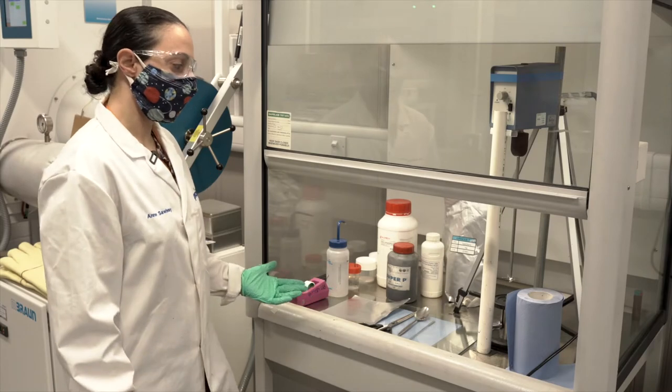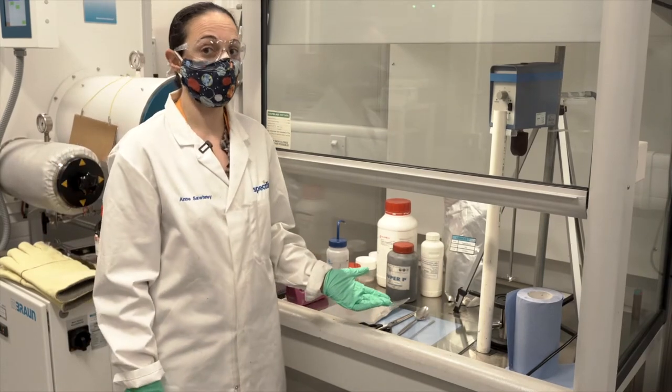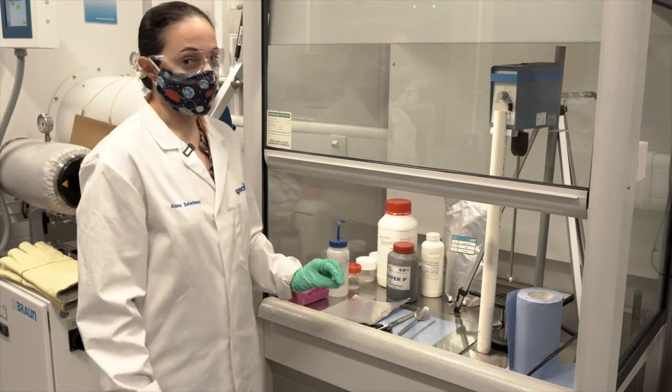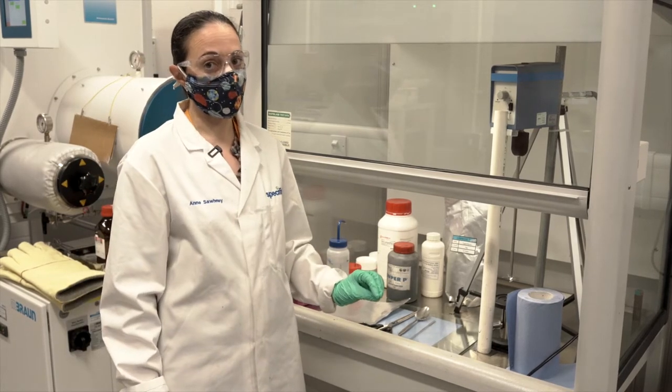In this video, I'm going to demonstrate how I mix and spread a hard carbon slurry to make an anode for a sodium-ion cell for research.